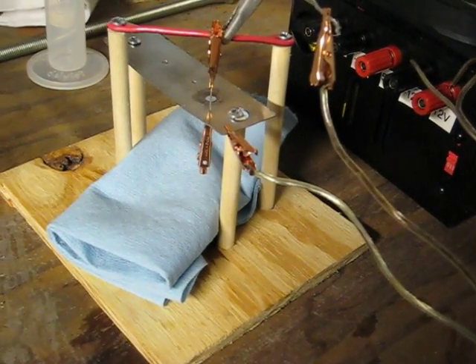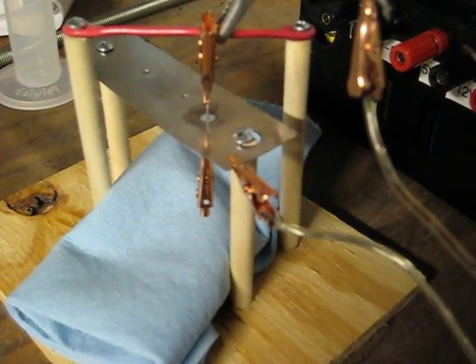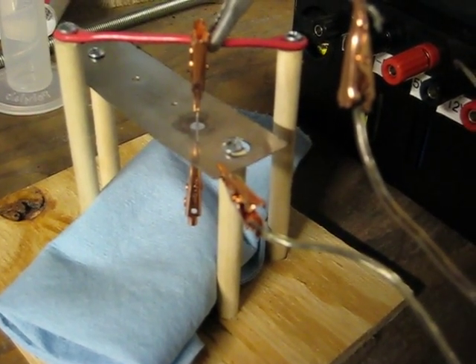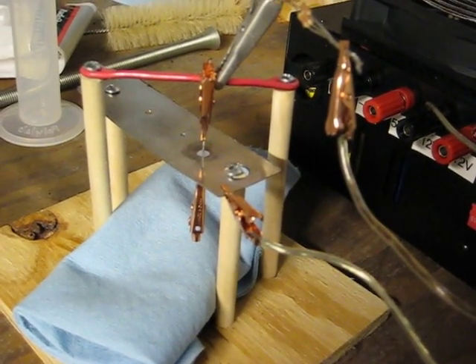So this is an attempt to etch tungsten wire. What you're seeing here is a drop of water suspended on that steel plate. Going through that steel plate is a bit of tungsten wire, and it's clamped on both ends. The clamp on the bottom is just to provide a little bit of weight and stability for when it breaks.